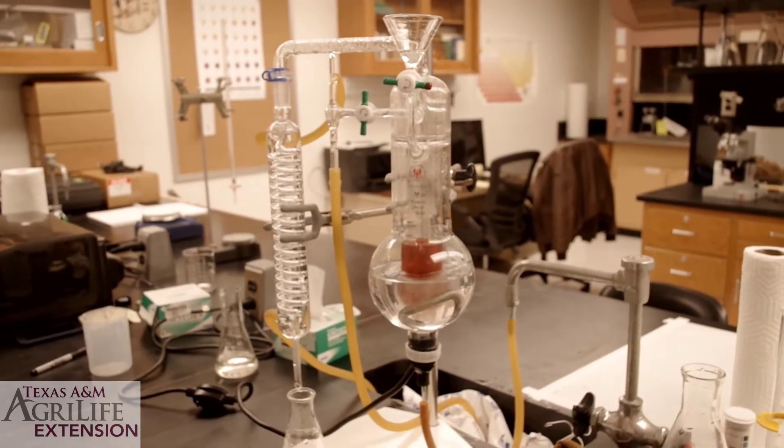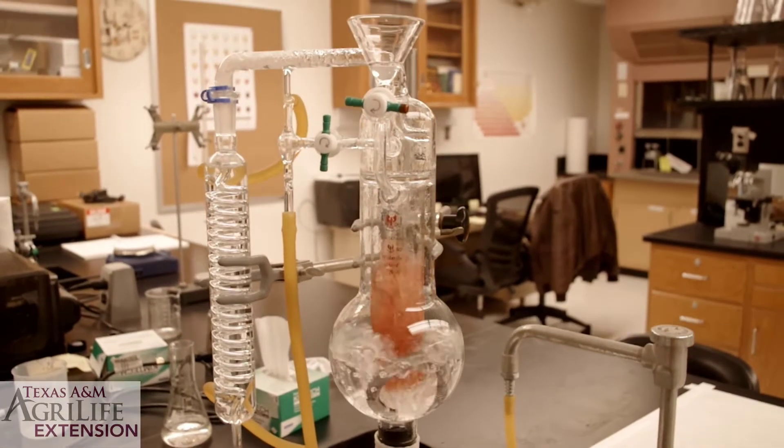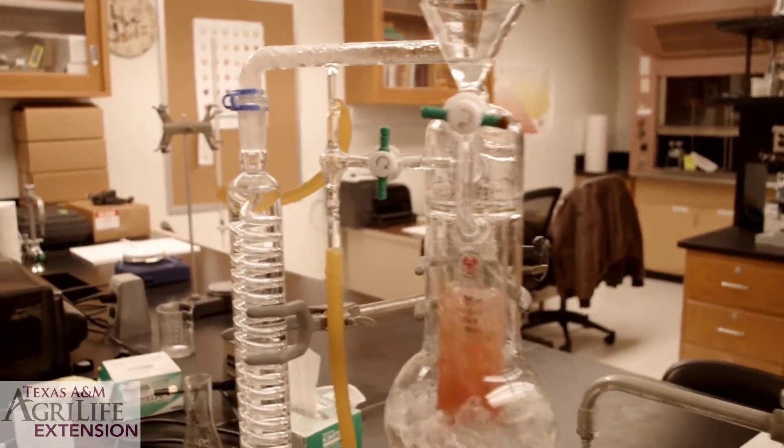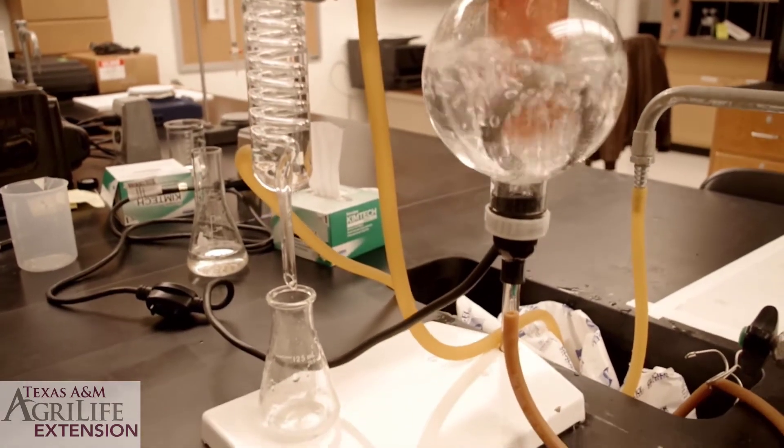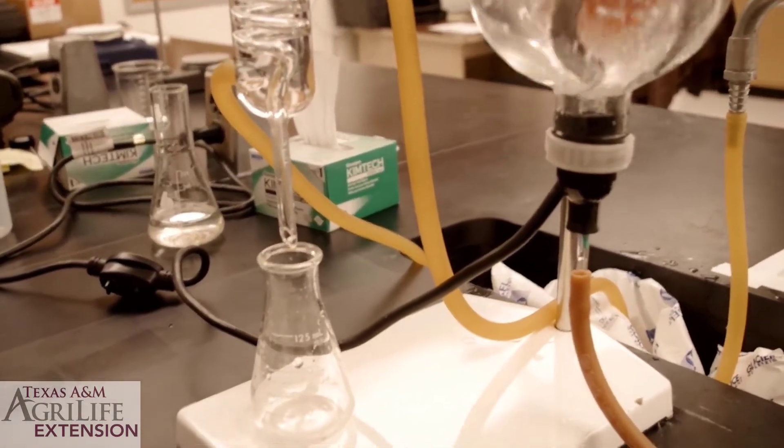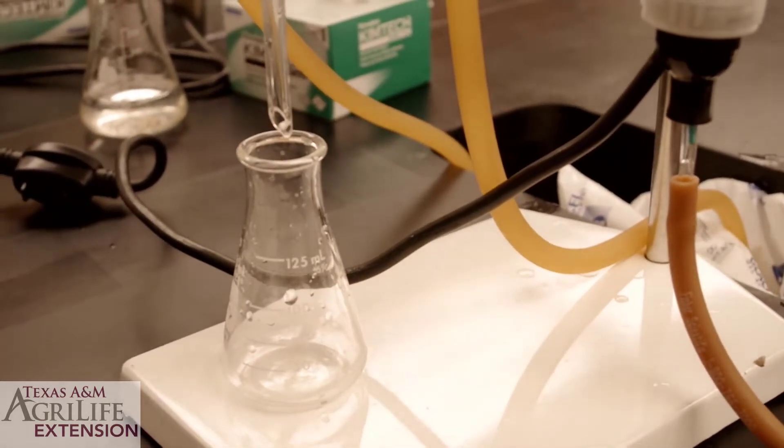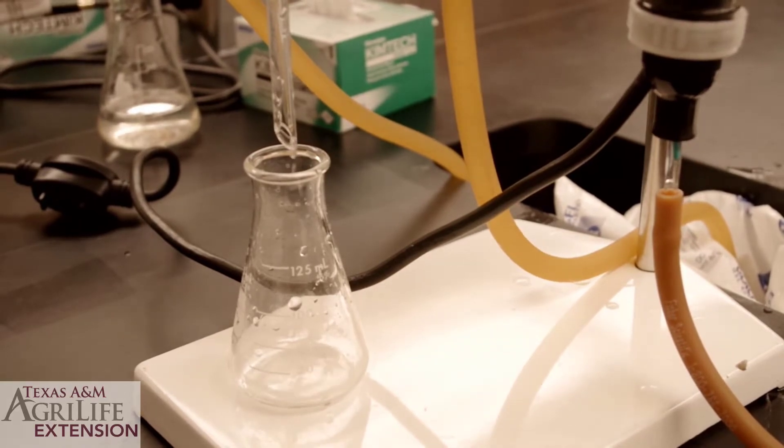The coil will start heating, the water will reach boiling point and will volatilize the acids of interest in your sample. The vapors will travel from the sample chamber through the coil in the cooling chamber where they will condense. Make sure you have a collecting flask underneath your cooling chamber.